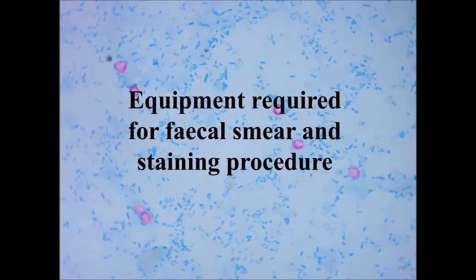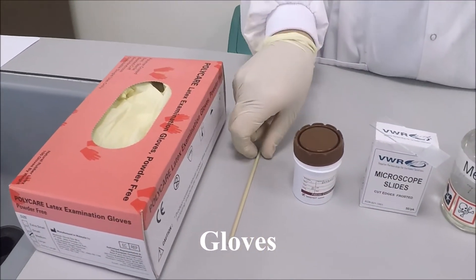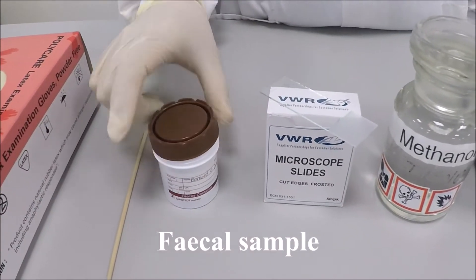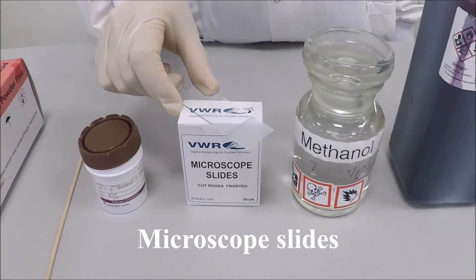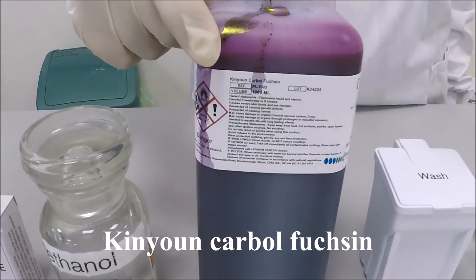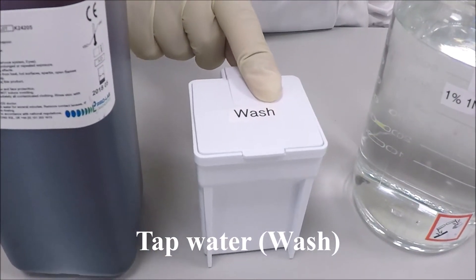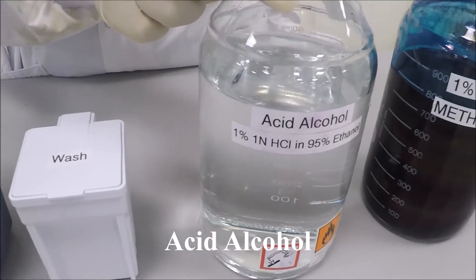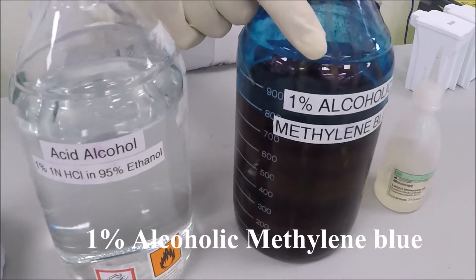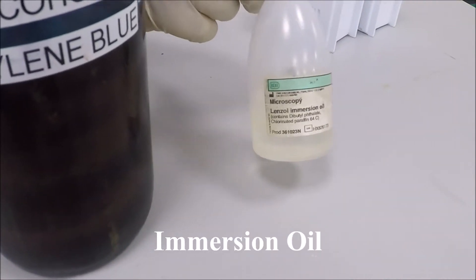This is the equipment required for your faecal smear and Kinyoun staining procedure: gloves, wooden applicator sticks, your faecal specimen to be analysed, microscope slides, methanol which is used as a fixative, your Kinyoun carbofuchsin stain, ordinary tap water as a wash, 1% acid alcohol, and 1% alcoholic methylene blue and immersion oil for microscopy.